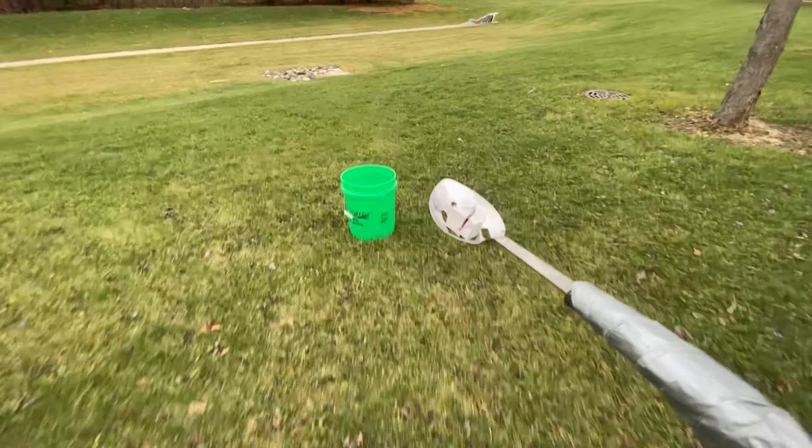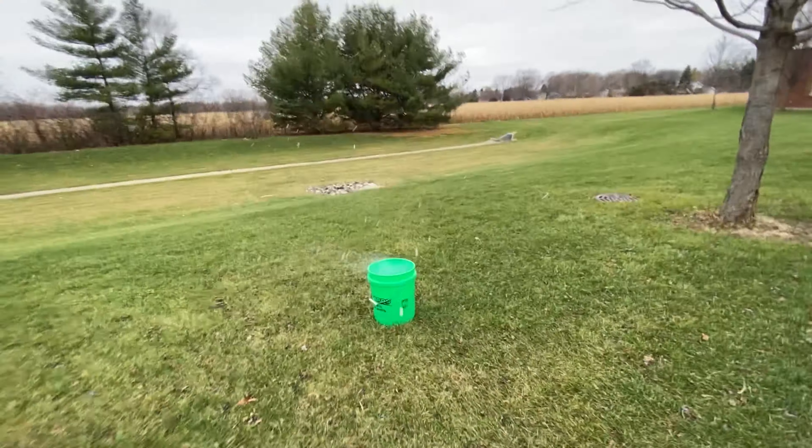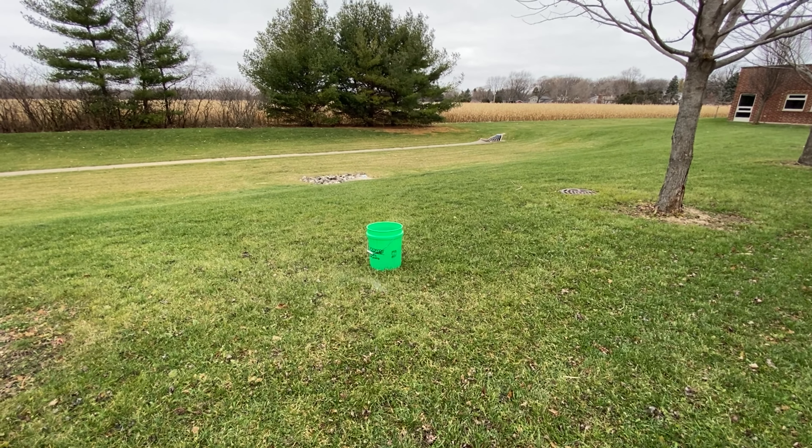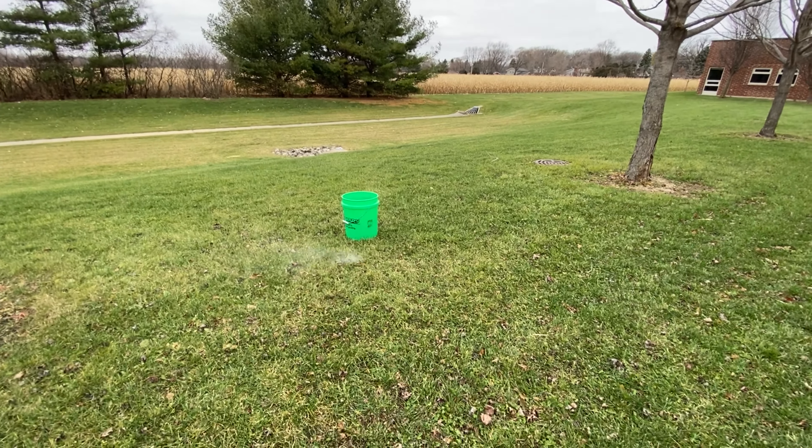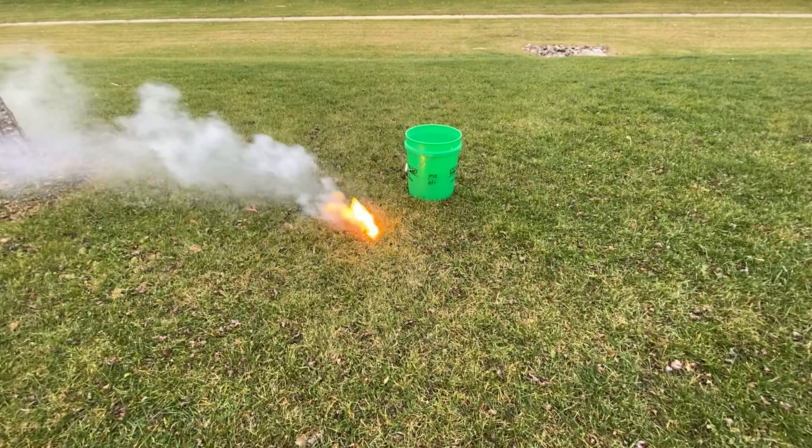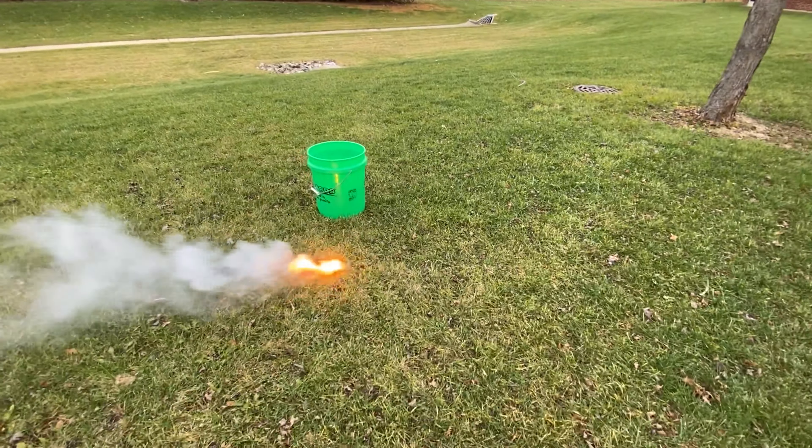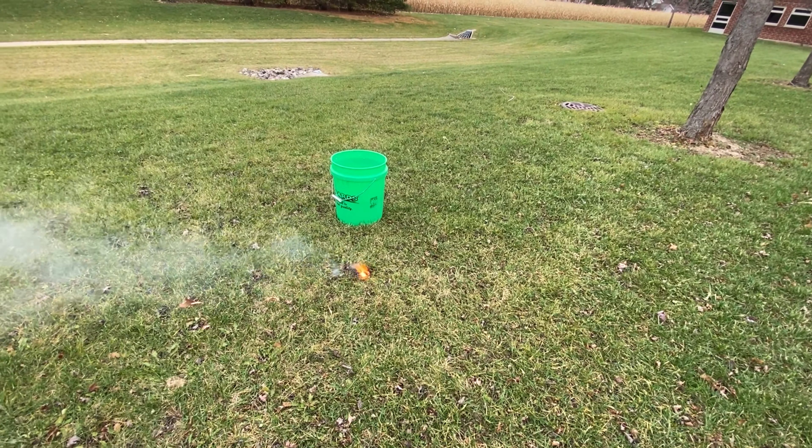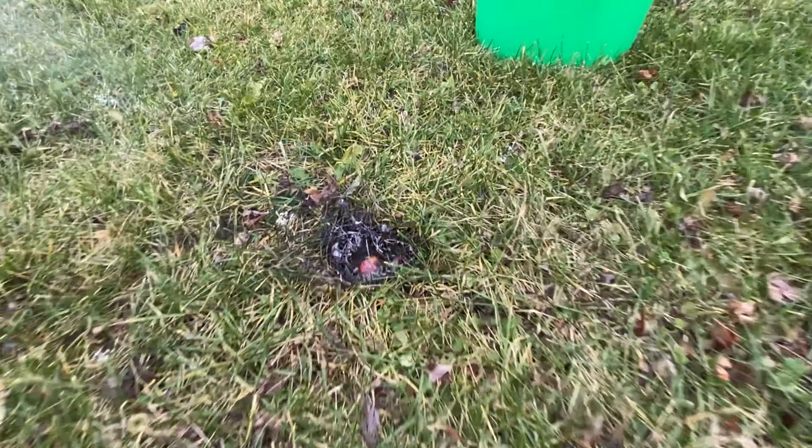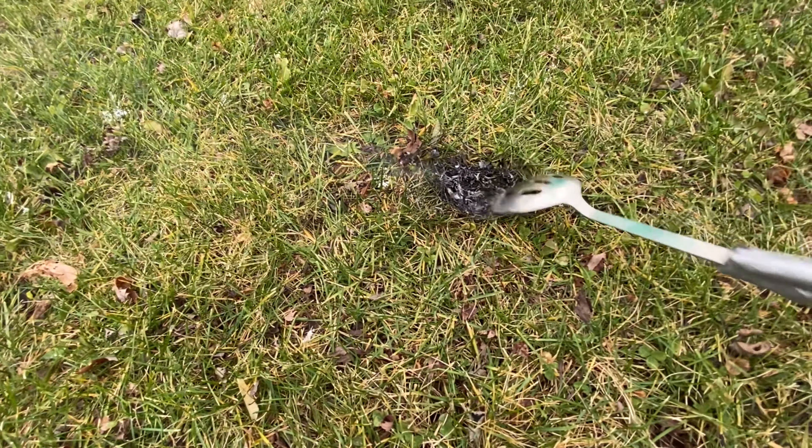Okay, you can see I got a bucket of water over there. I'm just going to use this spoon to, at a safe distance, drop a larger piece of sodium in. Let's see what happens. Ready? Three, two, one. We got a quick pop there. Some of the grass is on fire. That's always fun. Don't worry. The grass is plenty wet, and I have some pitchers of water behind me to put anything out that might start.